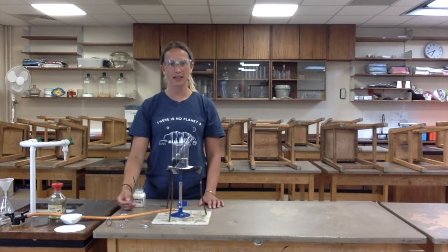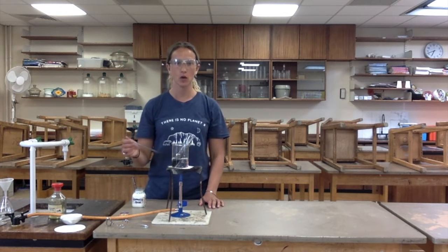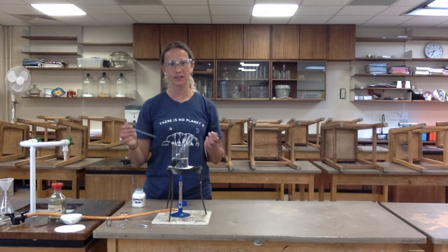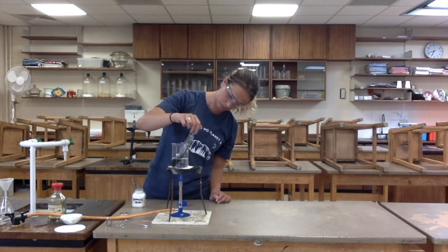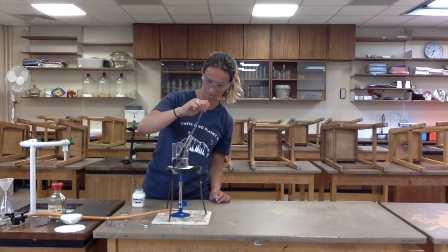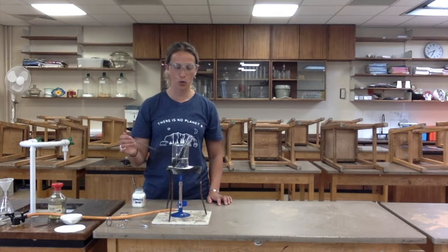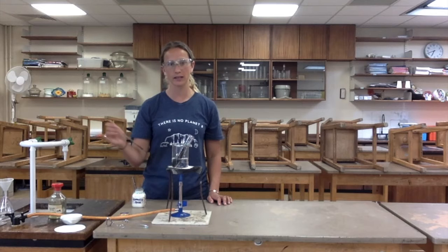The reason I need to use an excess of the copper oxide is to ensure that all of the acid has been neutralised. When we make a salt, it's a neutral compound that's come from a metal and an acid. So this metal is going to be displacing the hydrogen in the sulfuric acid, replacing it with metal. I'll know that it's completely neutral because no more will be able to dissolve, and therefore I'll have an excess of my copper oxide that I will later need to filter out.